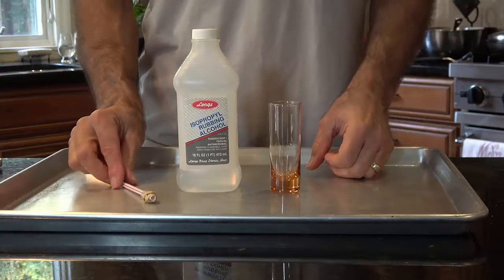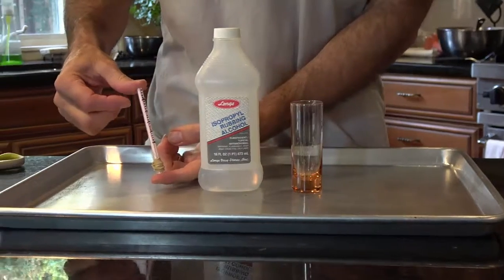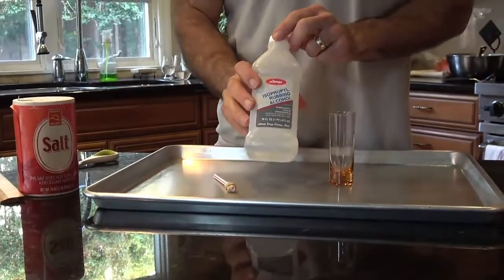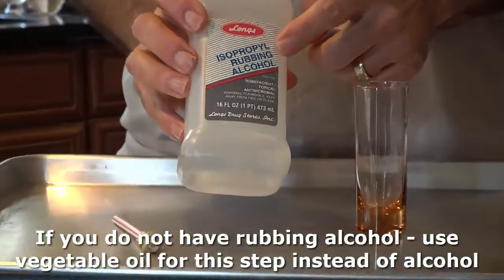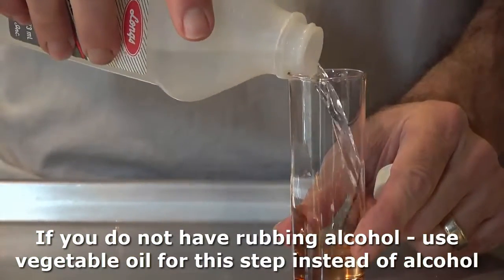Now we have to add a little bit of weight to the bottom of our hydrometer. This is going to measure the density of our liquid. So how do we do that? Well, we're going to start with the lowest density liquid we're going to measure, and that's probably going to be this one, rubbing alcohol, isopropyl alcohol. And we'll fill up our glass.